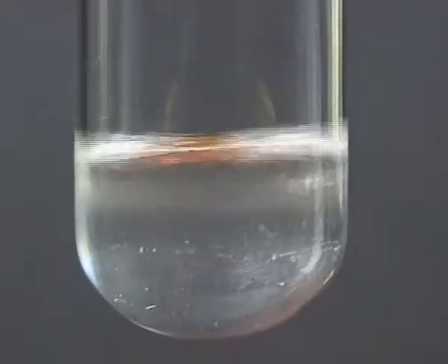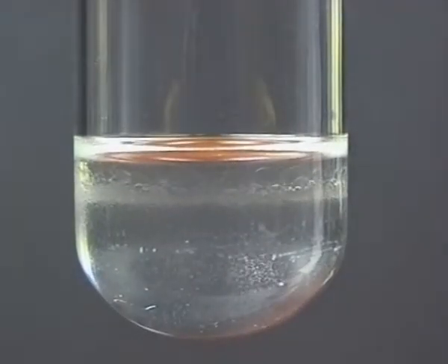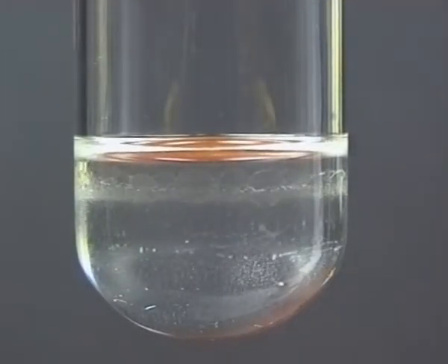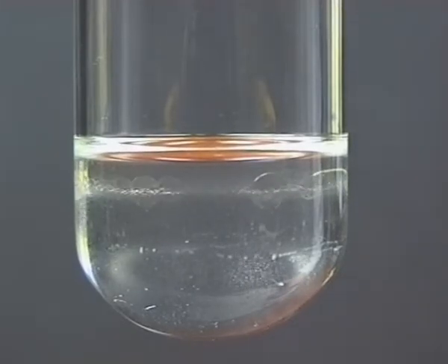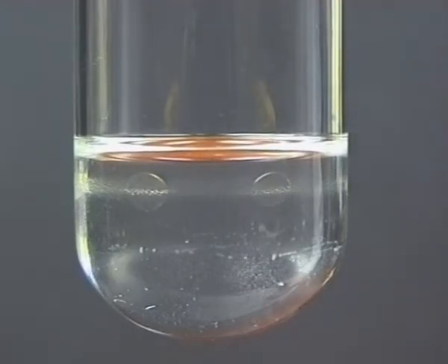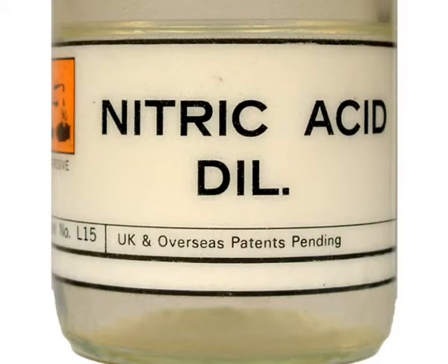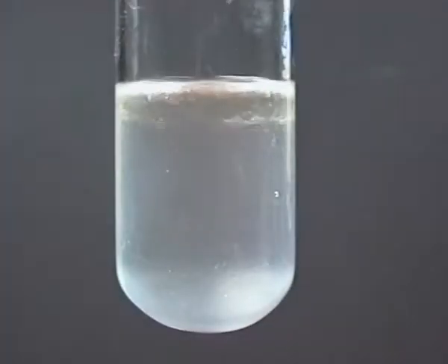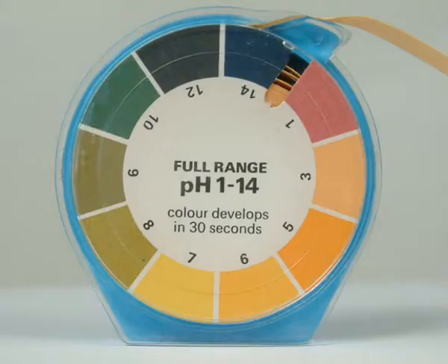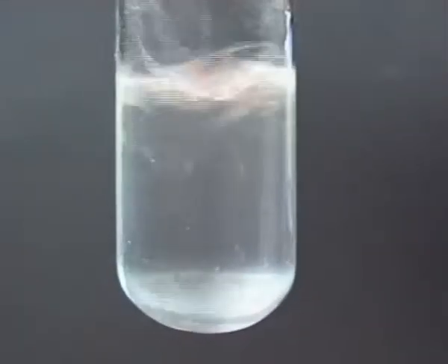The 2-chloro-2-methyl propane did not mix with the potassium hydroxide solution. Dilute nitric acid was used to acidify the mixture and full range indicator paper was used to check the acidity.